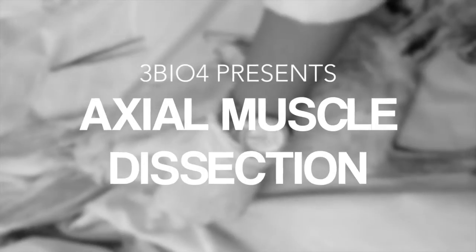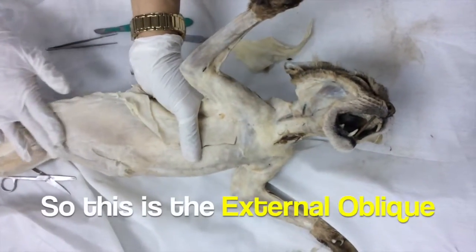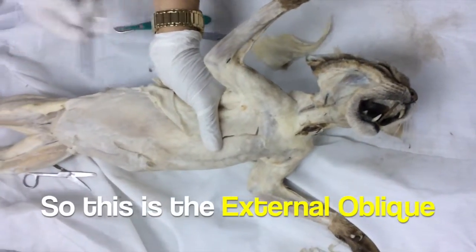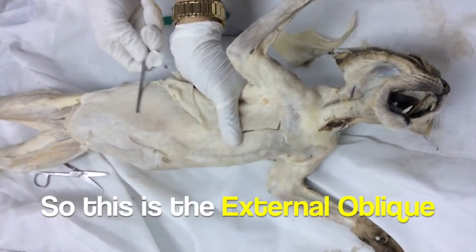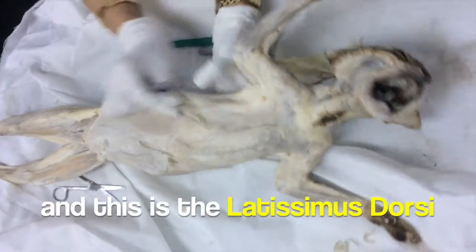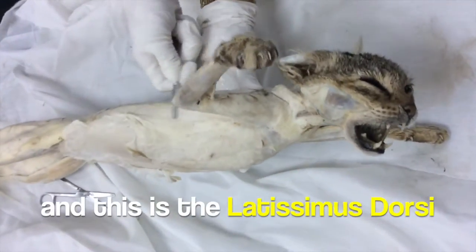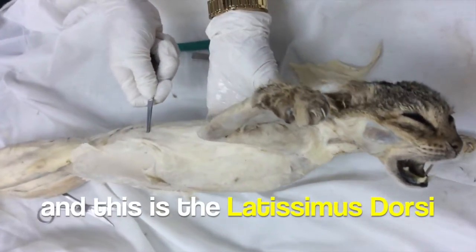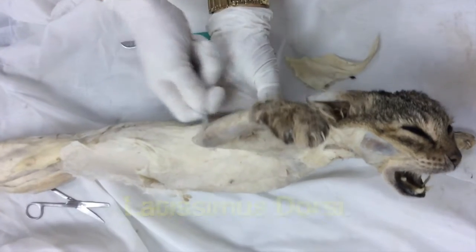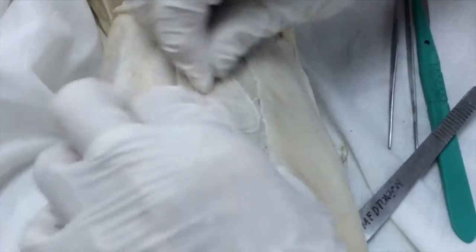This is so sharp. This is the external oblique, and this is the latissimus dorsi. Latissimus dorsi, external oblique.